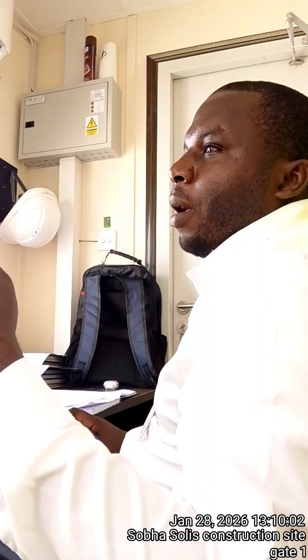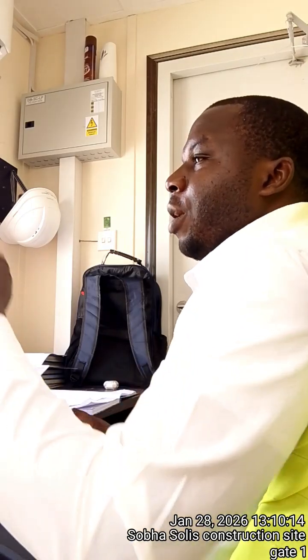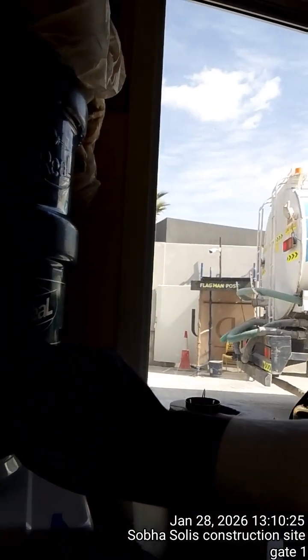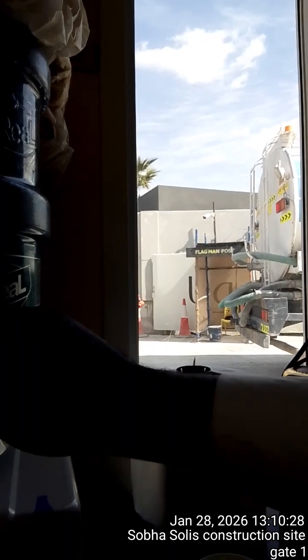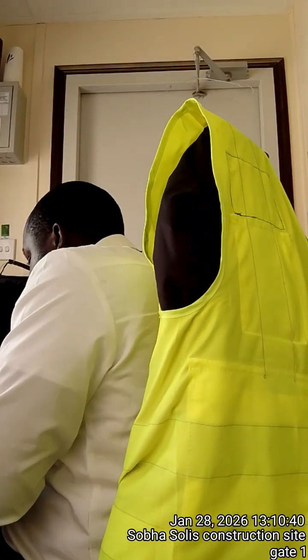So effervescence in simple terms is fizzing or bubbling. So when you say bubbling, meaning that in the water there is a composition of some carbonates. For example, when I look at my water here, it has a composition. This one is, we are lucky, it has a composition of 20 milligrams per liter of bicarbonates. So fizzing or bubbling, this one proves that there are carbonate ions in the water.